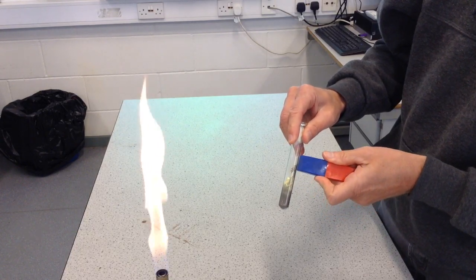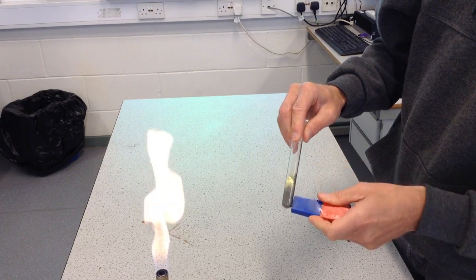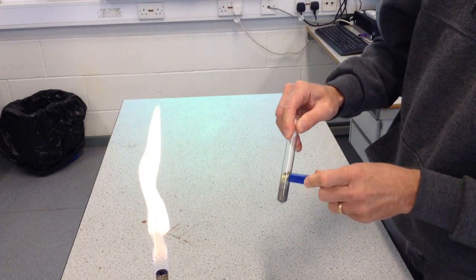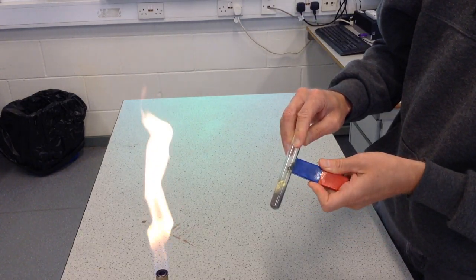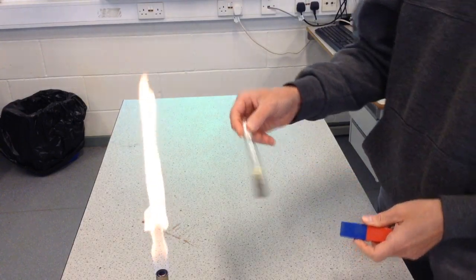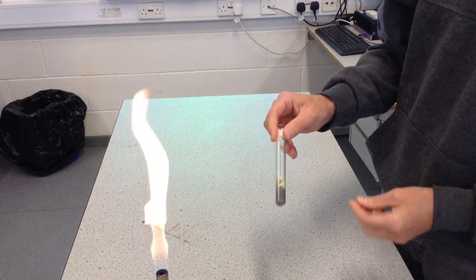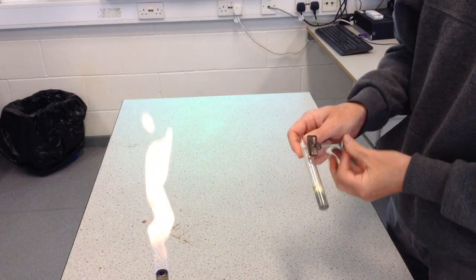You can see that I can pull the iron out, but the sulphur stays. So using a magnet and thinking about one of the properties of iron, I can separate these two from each other fairly easily. So there's our mixture. But what I'd like to do is chemically change this — turn it into a compound — and the way to do that is going to be to heat it.